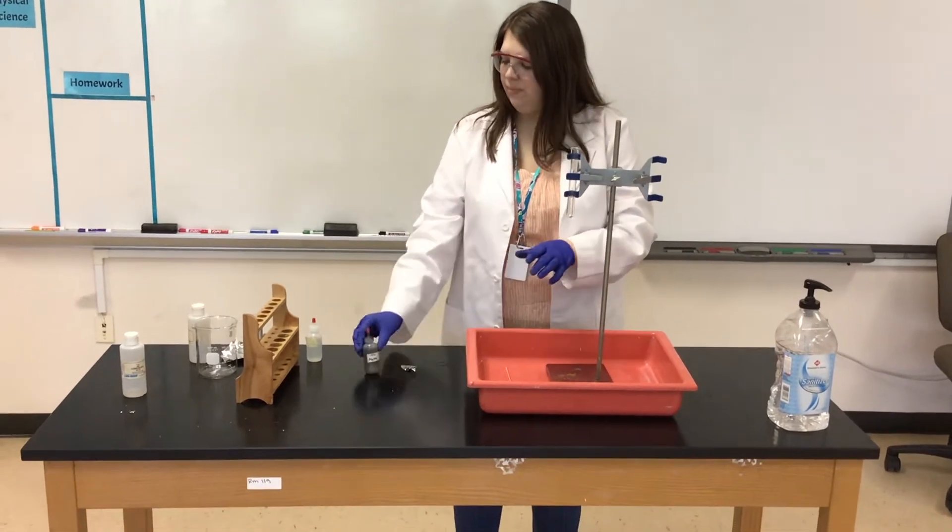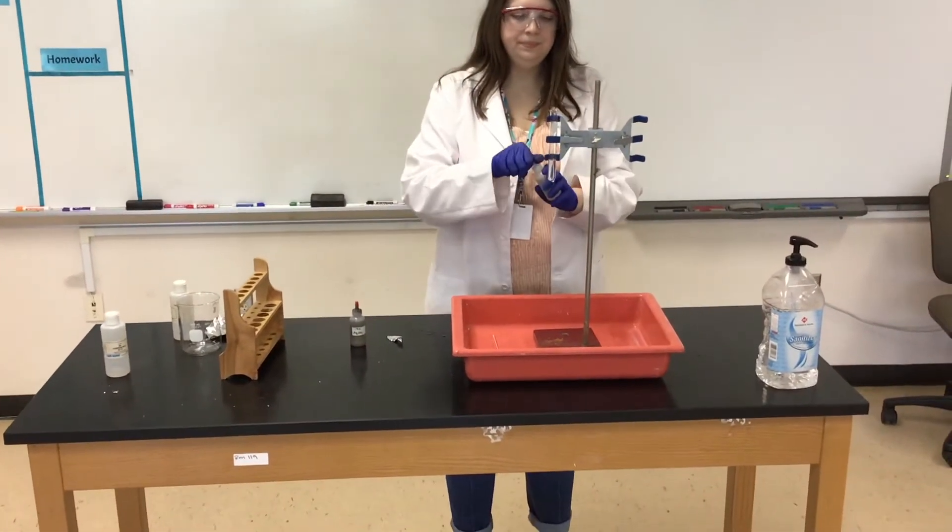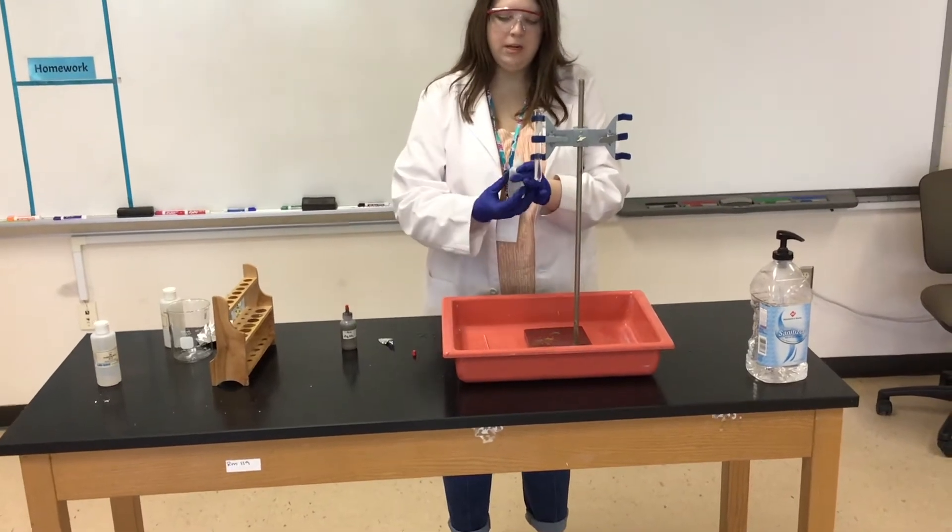Then we're going to take some potassium carbonate and put it in our test tube.